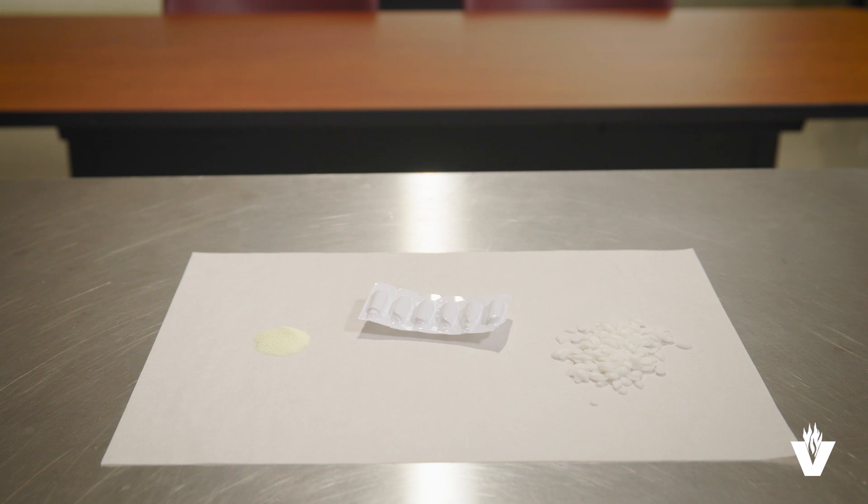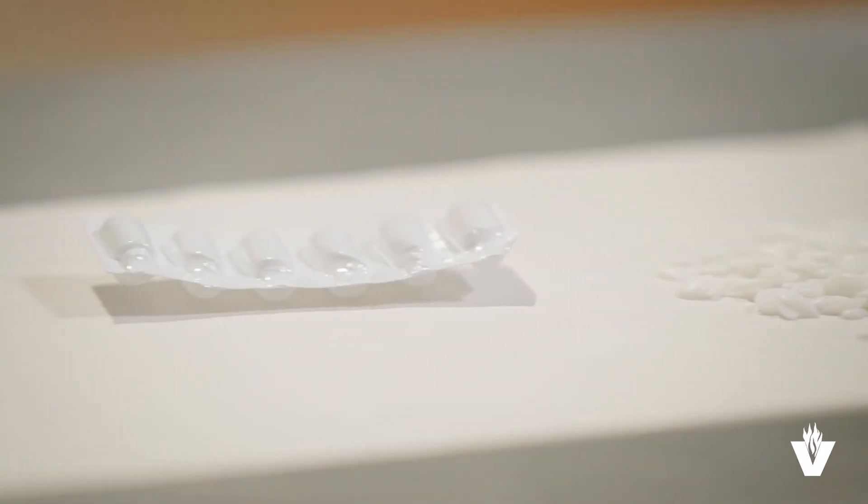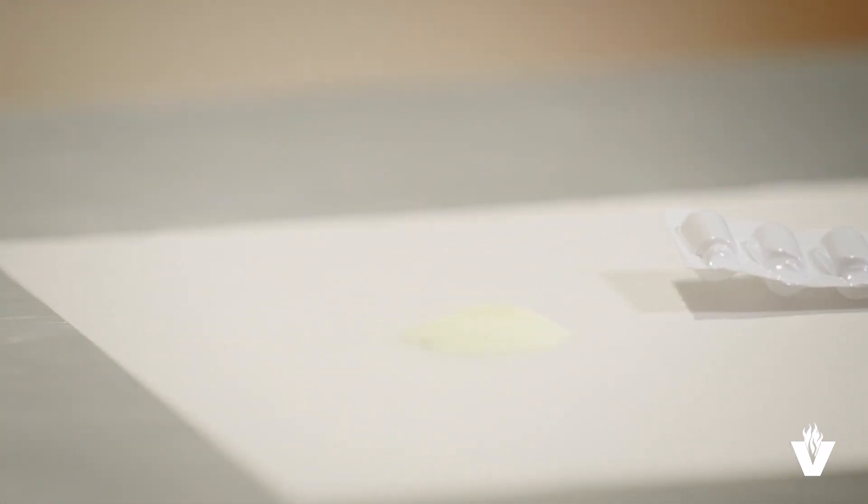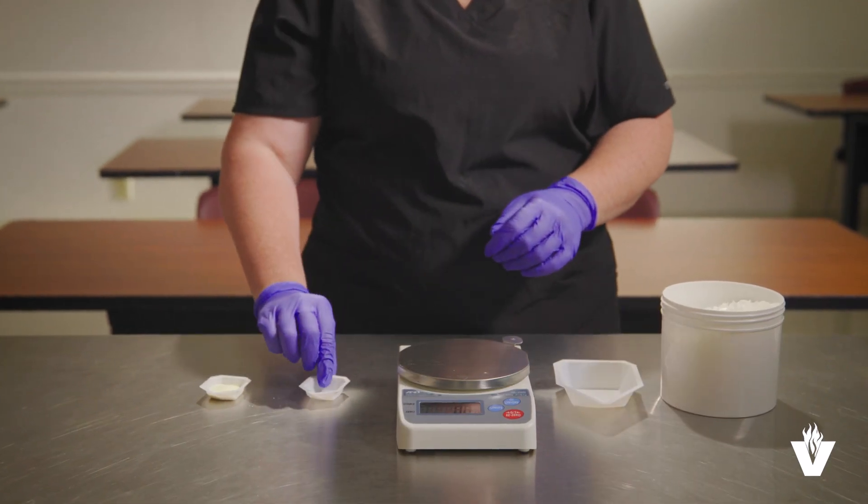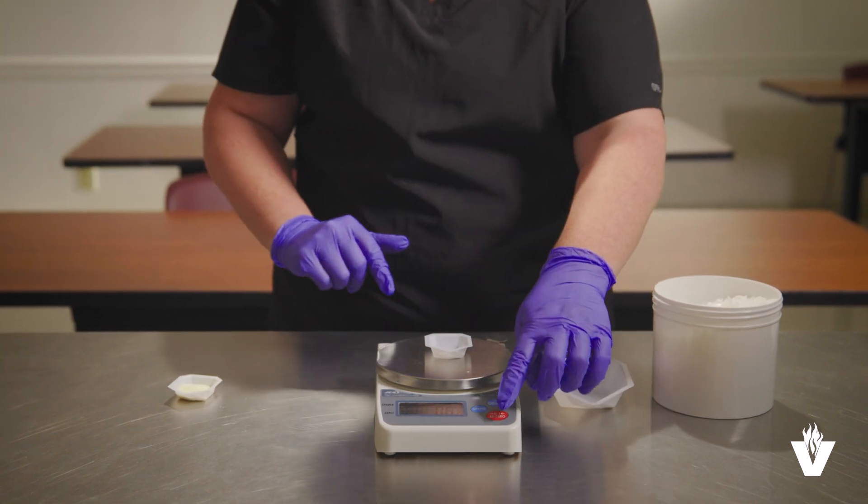The active ingredient for a suppository can be in the form of a tablet, capsule, or powder. For our active ingredient, we will use a powder. The base ingredient is a solid form that melts and can solidify again.